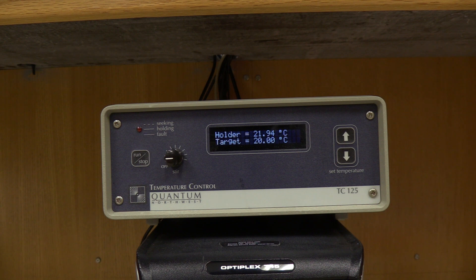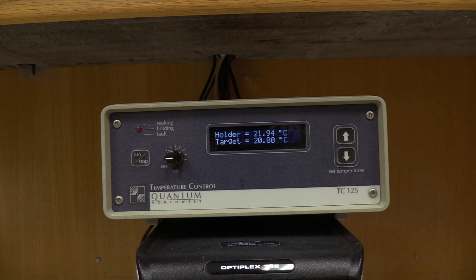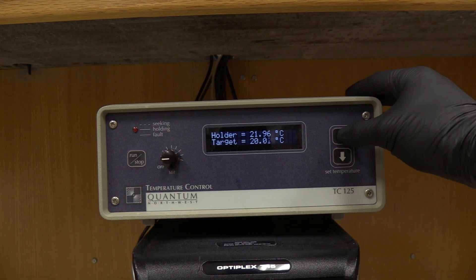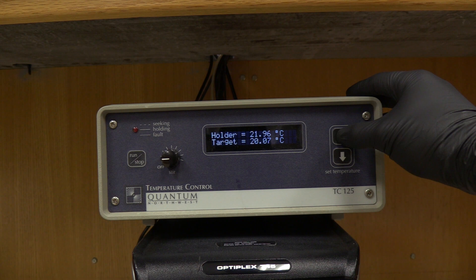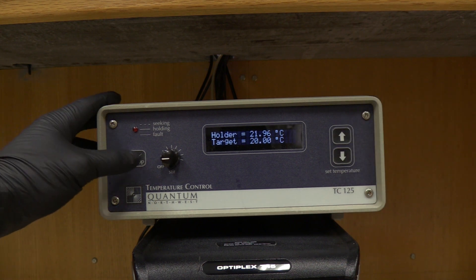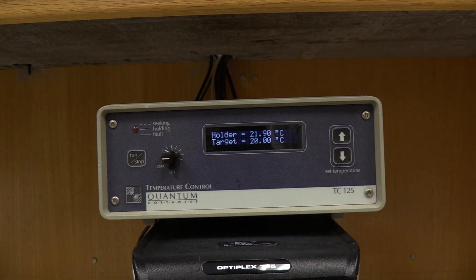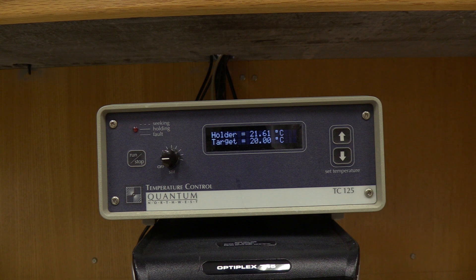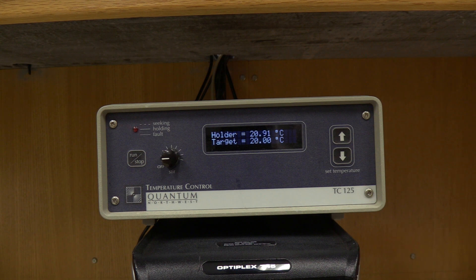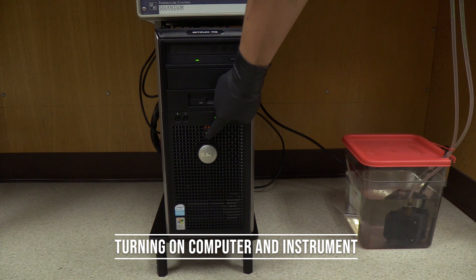Holder is the current temperature and target is the desired temperature. Use the up arrow to increase the temperature and use the down arrow to decrease the temperature. To start temperature control, press the run-stop button, turning on the computer and instrument.